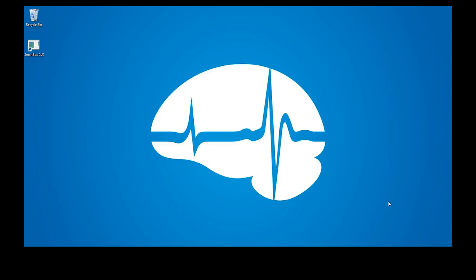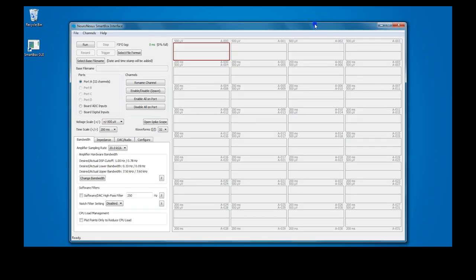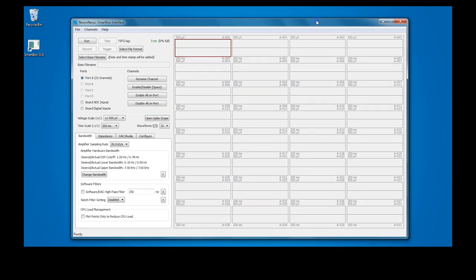In this video, we will show you how to perform a basic recording with the SmartBox. We are recording from the Manduca sexta Moth using a 16-channel NeuroNexus standard probe. First, open the SmartBox interface.